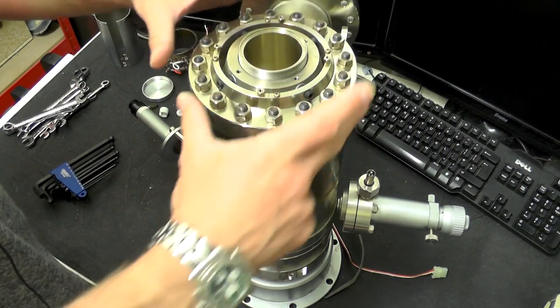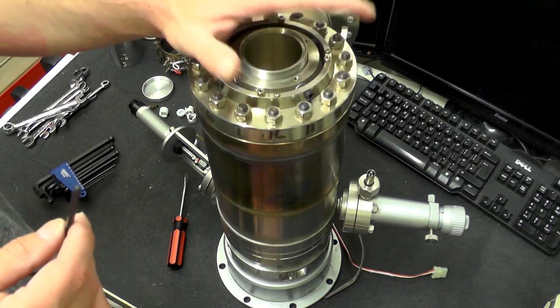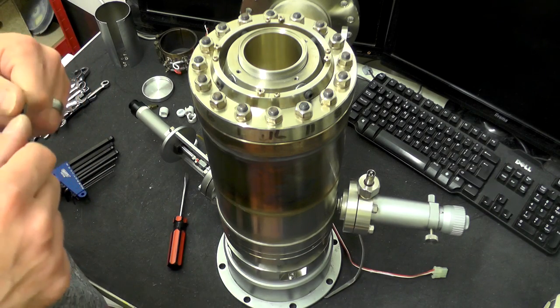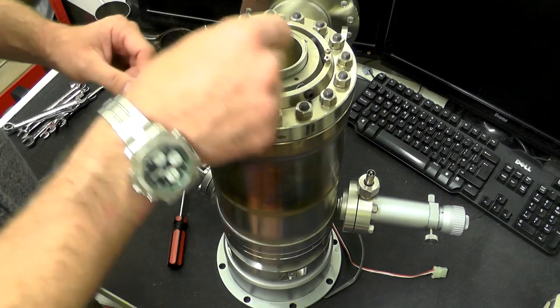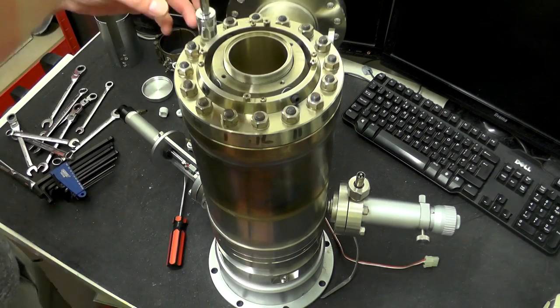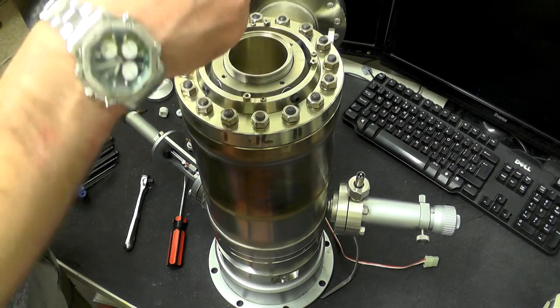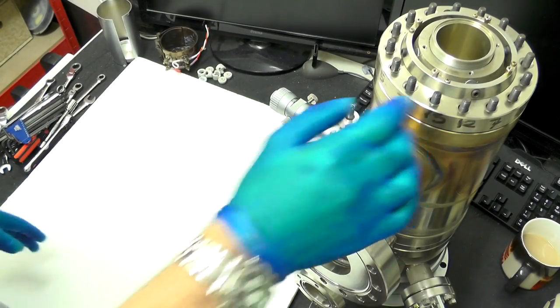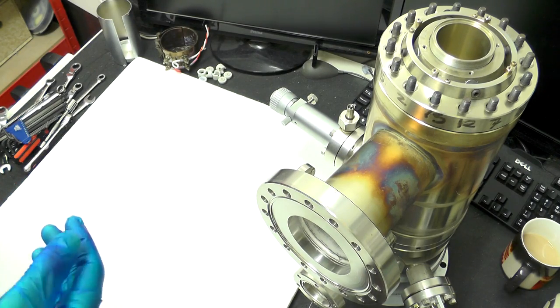I'm going to start by removing the top of this cover. I believe these were intended to be taken to pieces — the electron gun has a lifespan of about a thousand hours, so they would have been replaced periodically. That's obviously why somebody has written the taking-down sequence on here as a reminder. With all of those bolts off, this entire assembly and what I believe is the electron gun wants to come out as a complete unit.